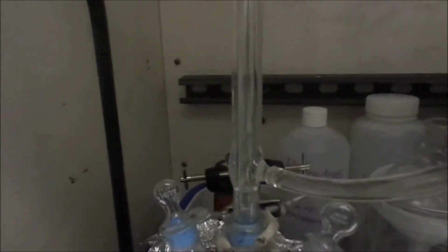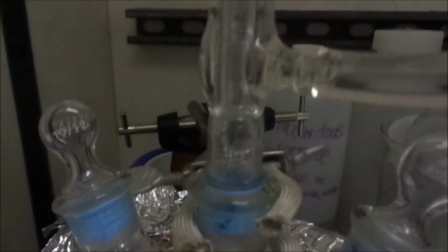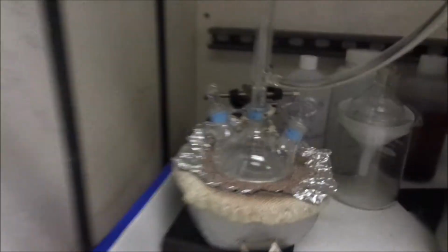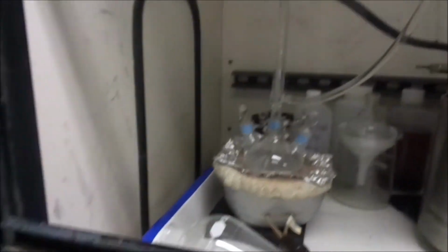Looks like that's not going to work. It's recondensing the mercury just fine, but it's doing it so well that the mercury is condensing right here, and then almost immediately dropping right back down into the distillation chamber, actually preventing it from being able to heat up enough to fill the column. You know, it was worth a shot. Didn't work out. Let it run.